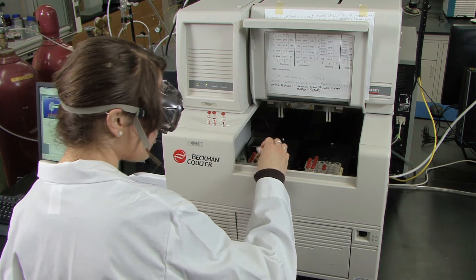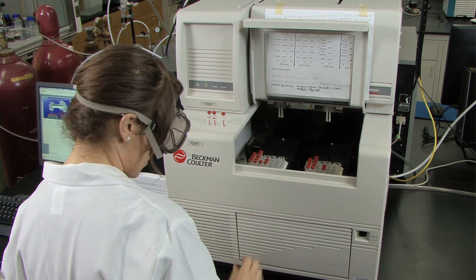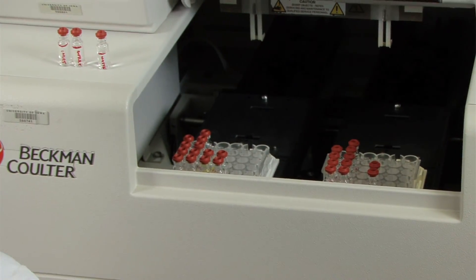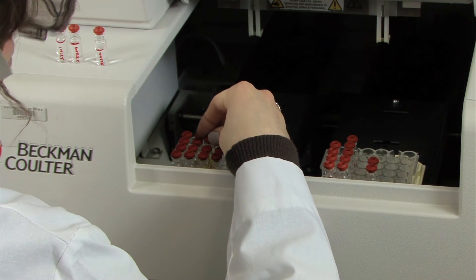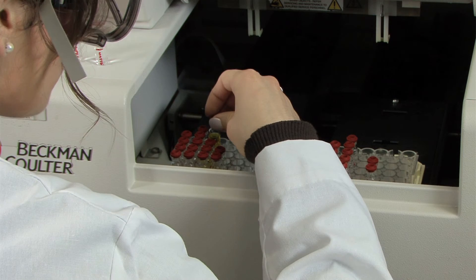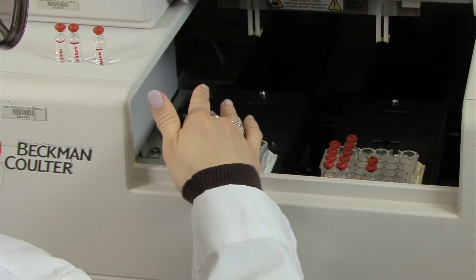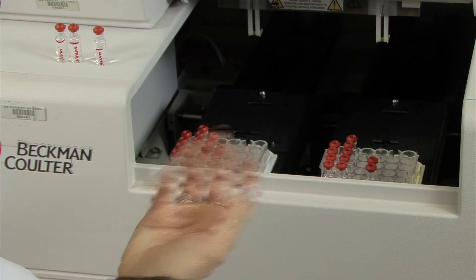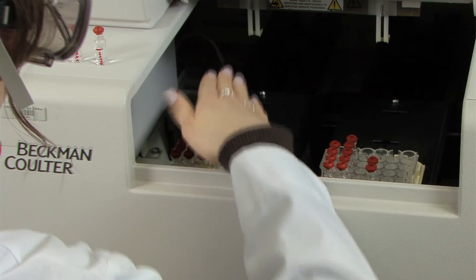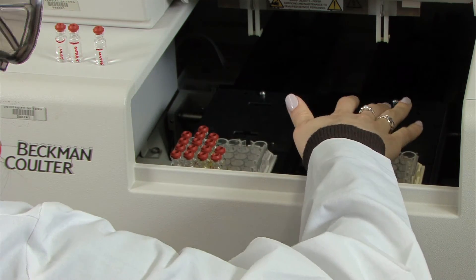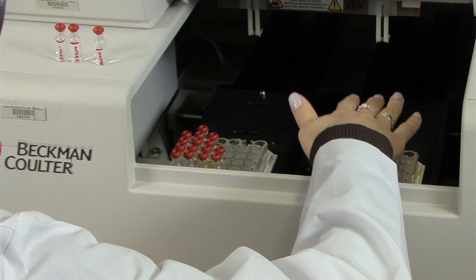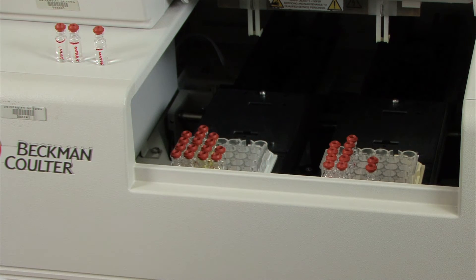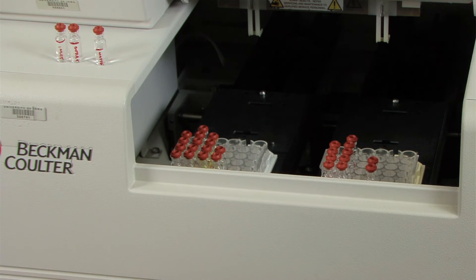So to load your vials, you just take them and set them into the tray. There is the grid that is located just above the tray that shows you exactly where to load your samples. I am loading mine into the column C into the morning section just for demonstration purposes. Here is where you want to make sure that all of your lids are flat and flush, so you can just take your hand and gently touch on the top. Because again, if the lids are not flush and flat, then you have a potential to break the capillary.